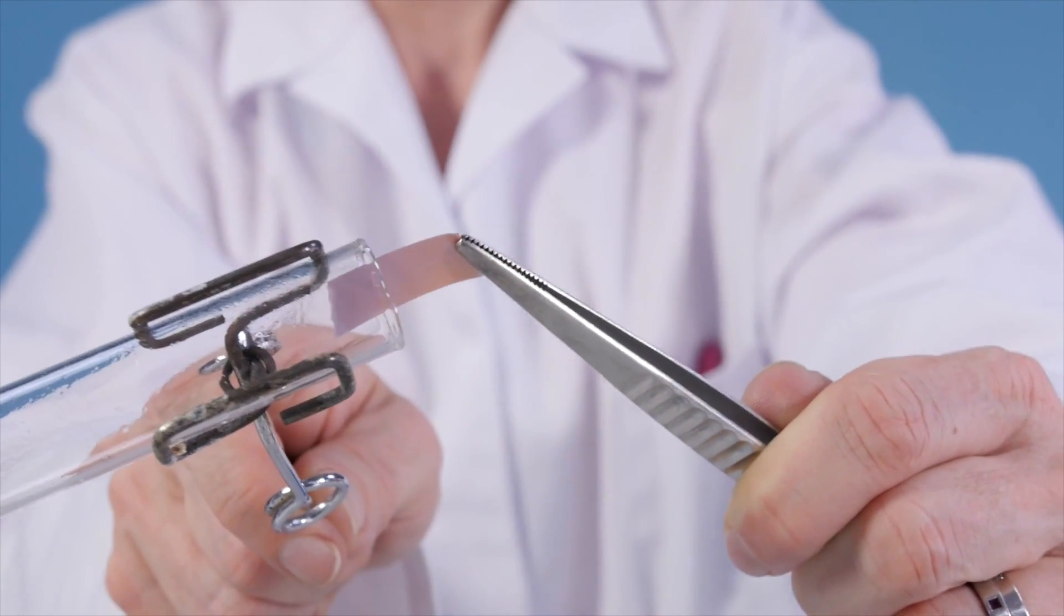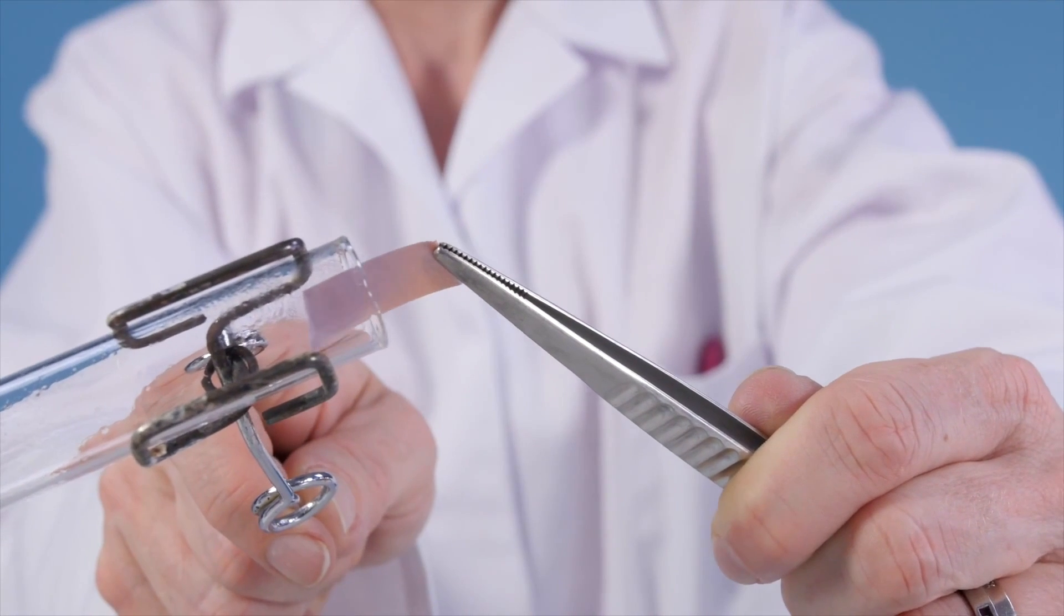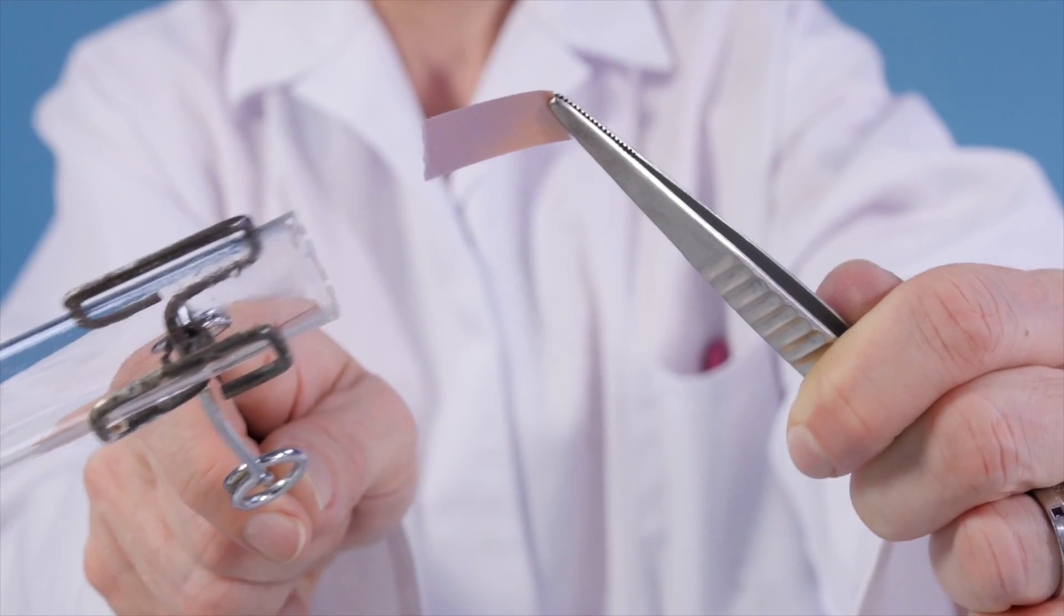Test the pungent smelling gas given off with damp red litmus paper held in forceps, avoiding breathing in the noxious fumes.